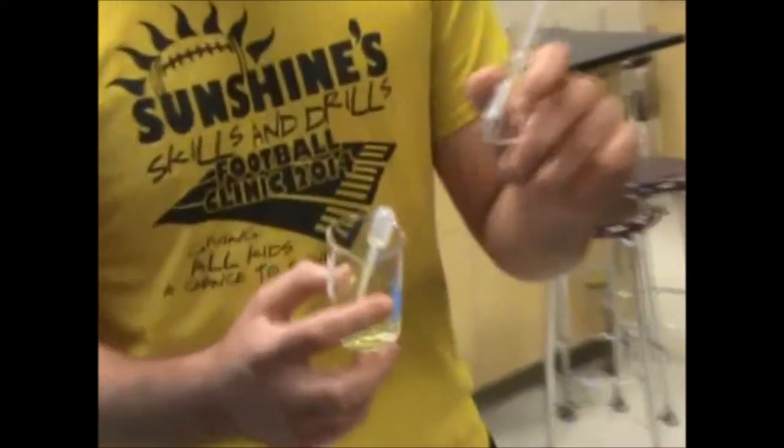Oh, now you're Mr. Miles, your ferrocyanide test isn't working. So you took cobalt and then you added to the ferrocyanide. And nothing yet. It didn't form precipitate? No. Show me what you did. I took this and mixed it with this. You took this? Yeah. What is this? It's cobalt.